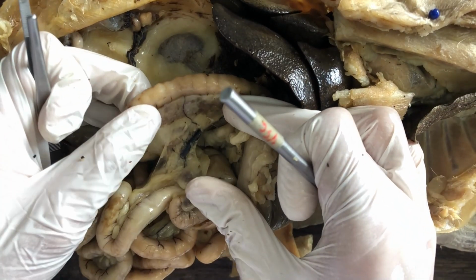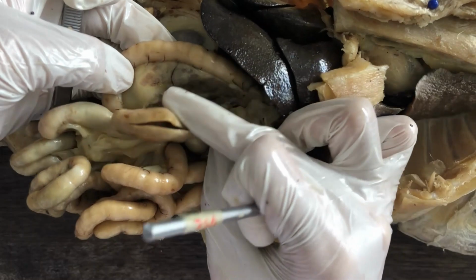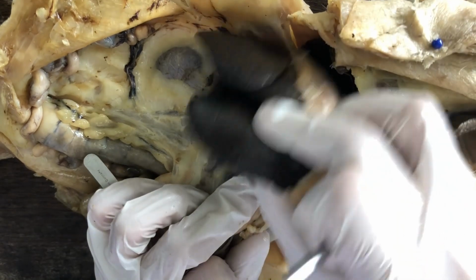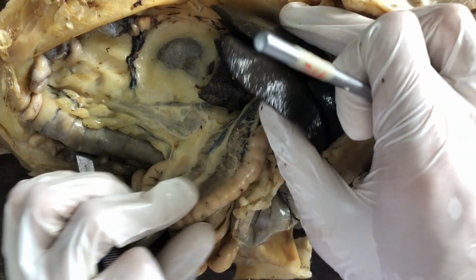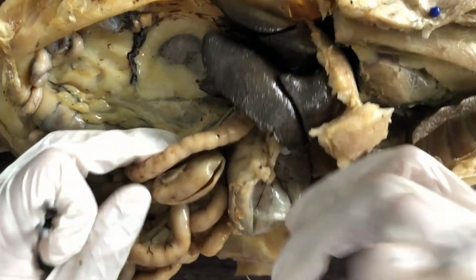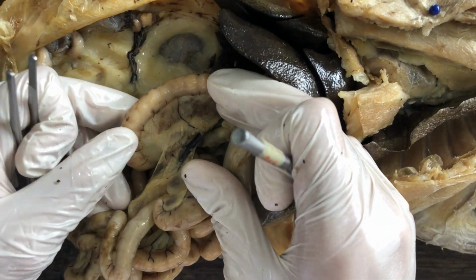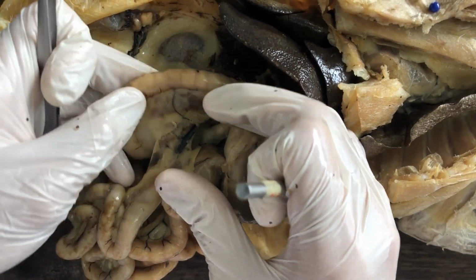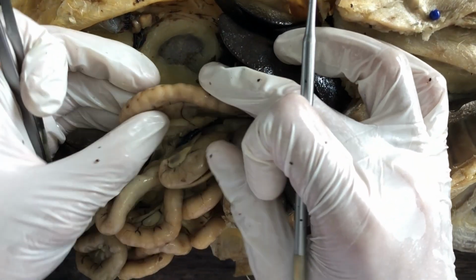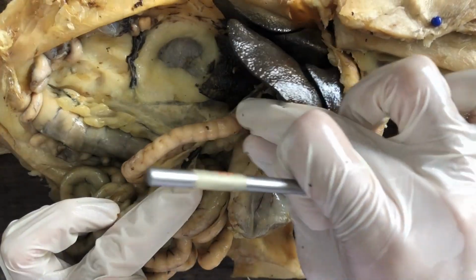because this is the site where the digestive enzymes coming from the pancreas will be emptied, and also some bile coming from the gallbladder and the liver will also be emptied into the duodenum. And so those bile acids will emulsify the chyme, helping in digestion of fats, of lipids, so that they can be absorbed, whereas the digestive enzymes coming from the pancreas will further digest the carbohydrates and proteins. Right? And those secretions all empty into the duodenum.